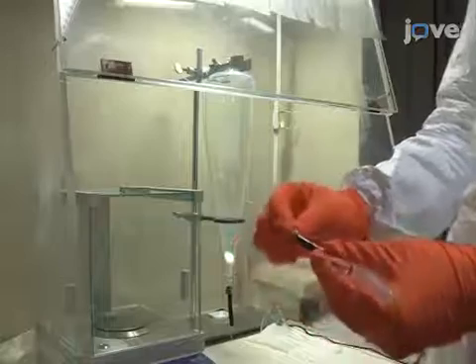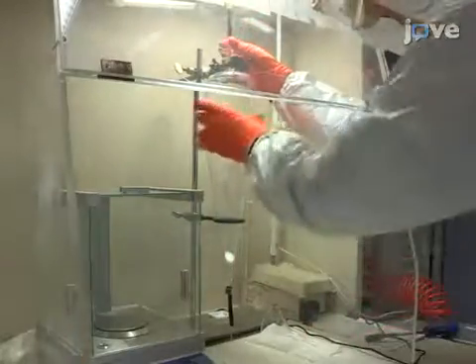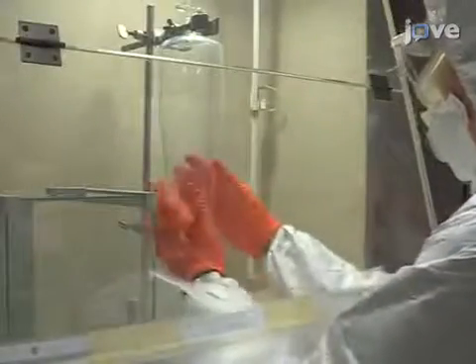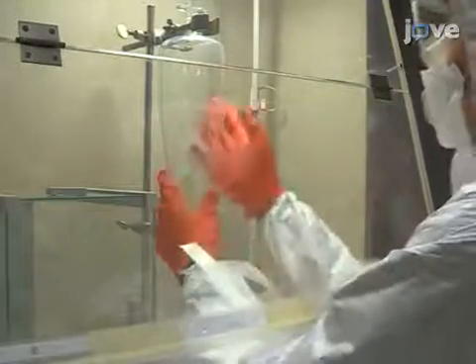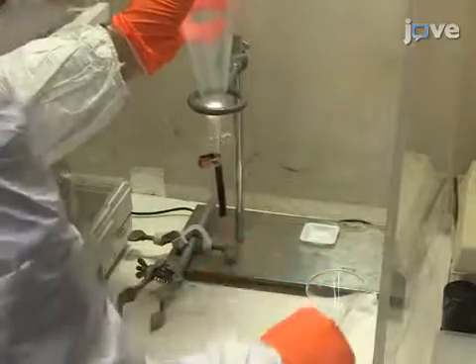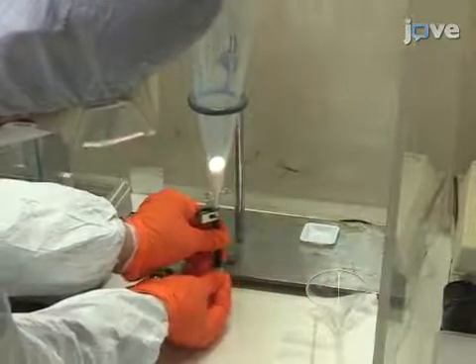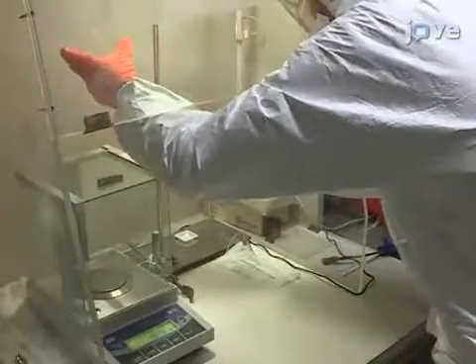Close the top opening of the generator. Gently tap the side walls of the generator to move the deposited powder down to the bottom, making sure the majority of the powder particles reach the bottom rather than remaining on the sloping walls. Next, remove the stick at the generator bottom and close the bottom opening with a plastic cap to avoid particle loss during transfer. Remove the generator from its support to take it to the experiment setup.